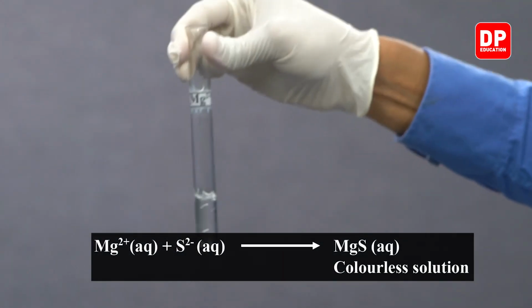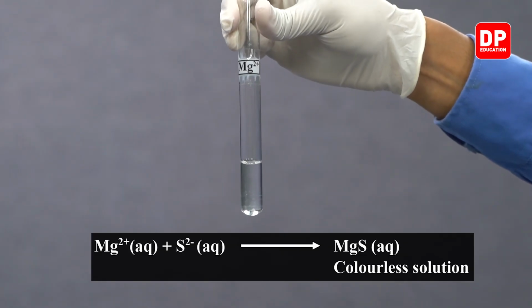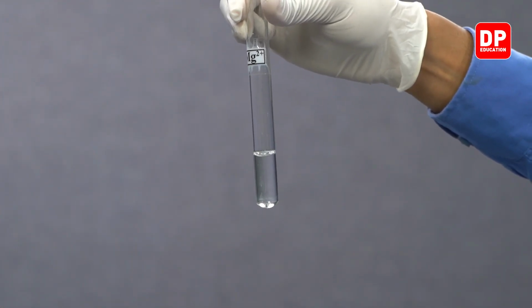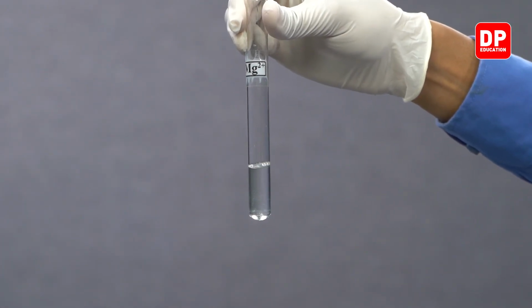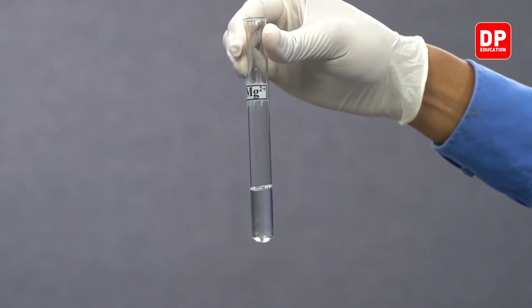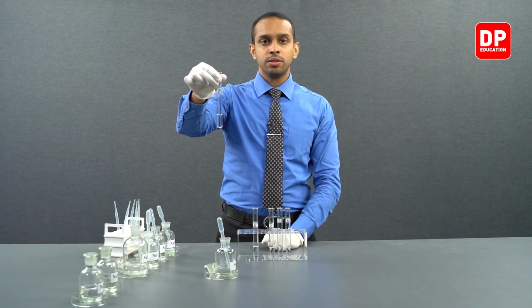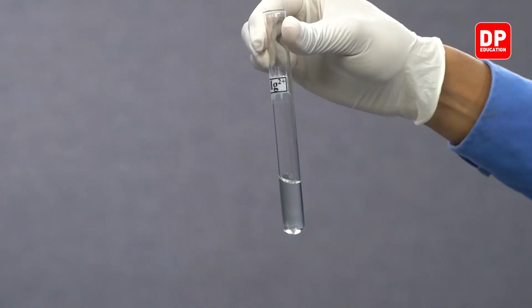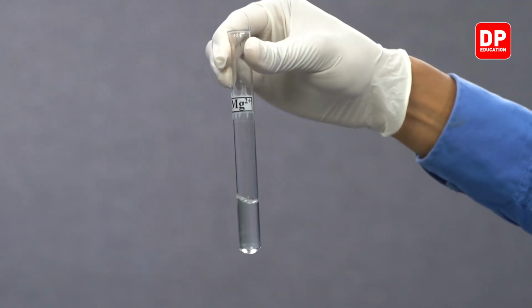Now let's mix it well and see whether magnesium ions, when in contact with sulfide ions, form a precipitate. As you can observe here, we do not form a precipitate when magnesium 2 plus ions come into contact with sulfide ions. Magnesium sulfide is water soluble and therefore will not form a precipitate.